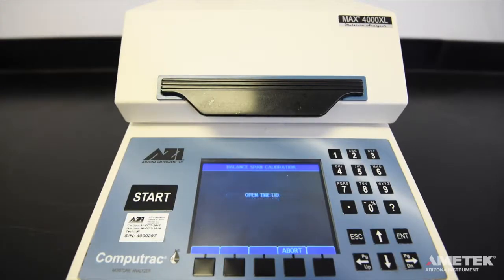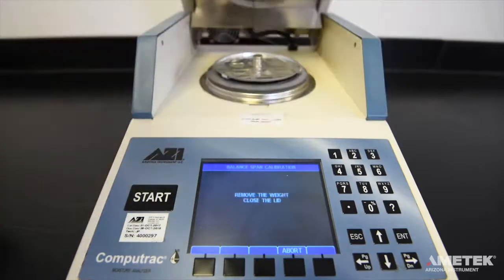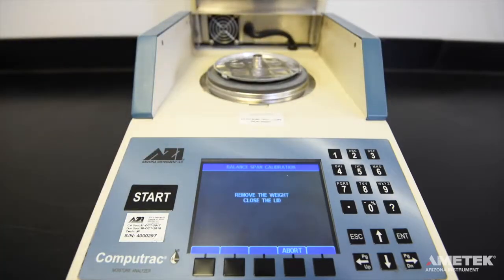When prompted, open the lid and use the tweezers to remove the 20 gram weight from the pan.